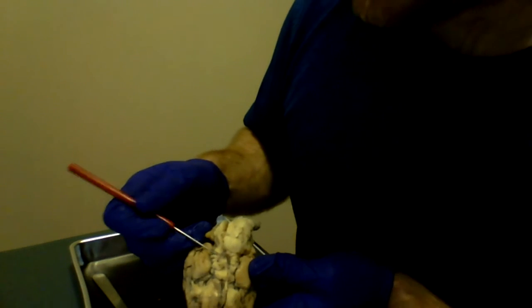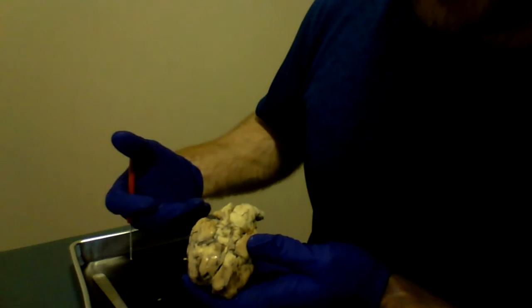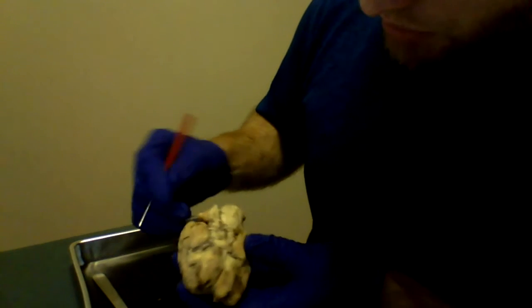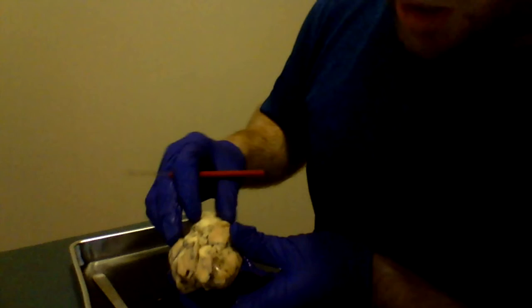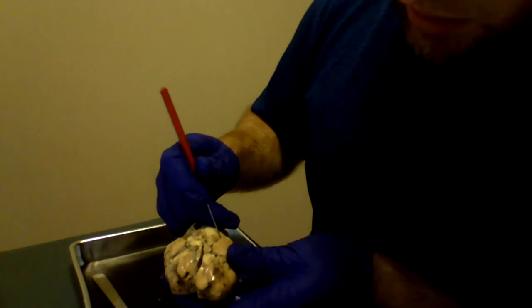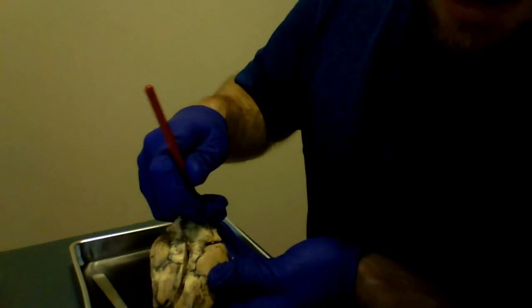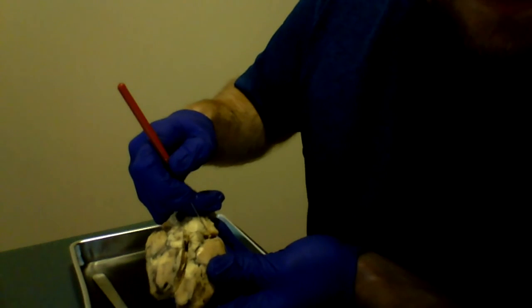Then we come around to the trochlear nerve, nerve 4, and also again it doesn't show up too well, and in fact I believe it might have separated from my poking and prodding, but you would see your trochlear nerve in this area, and there's like the remains of what I was poking around with right there.